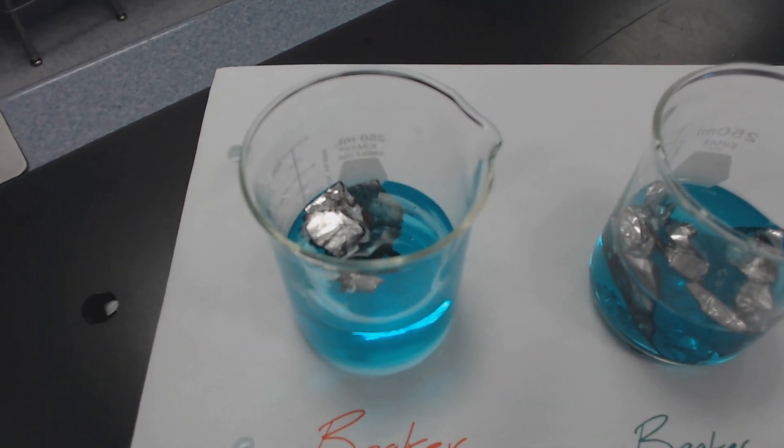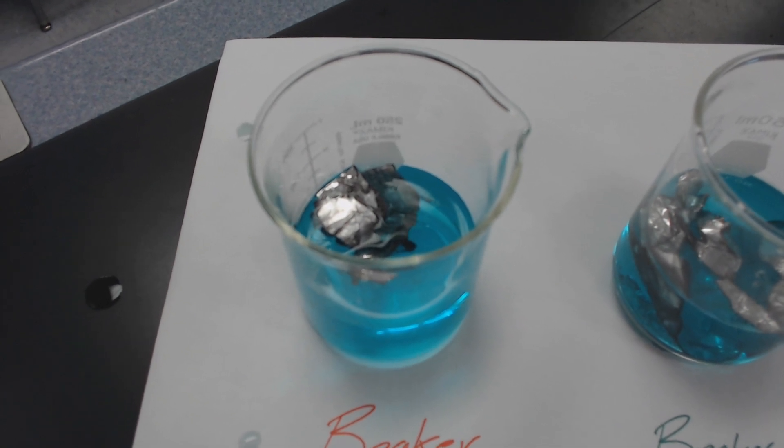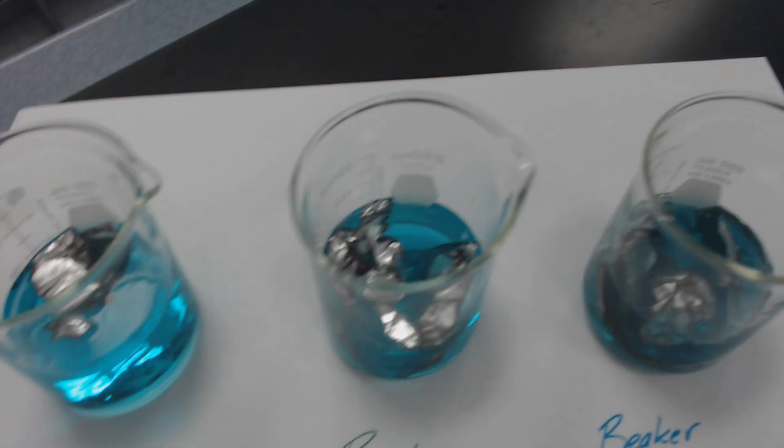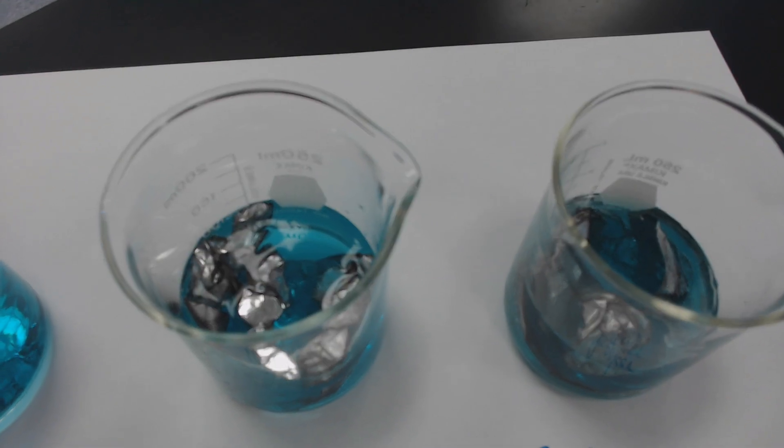As you might be able to notice and even hear a little bit, you'll notice that we do have the indicators of chemical reaction occurring. I can hear and see bubbling. We see color change.